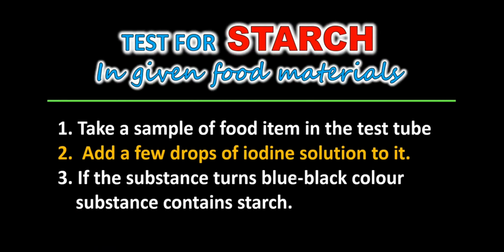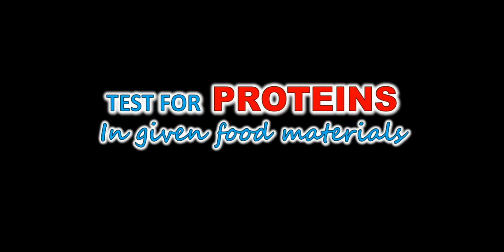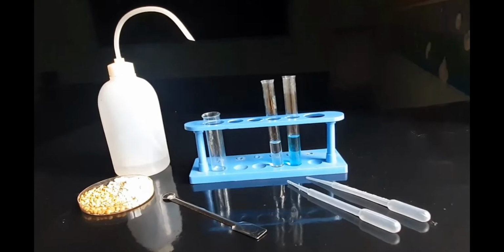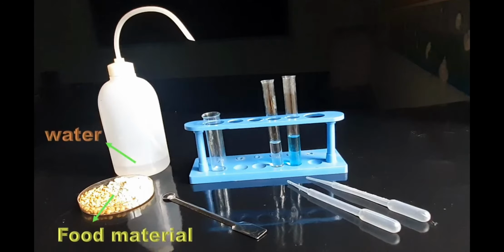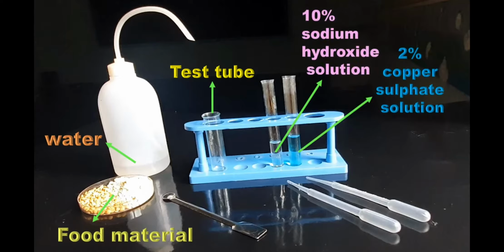So this is the test for starch in given food material. And the next is the test for protein in the given food materials. For this test we need food material, water, test tube, 10% sodium hydroxide solution and 2% copper sulfate solution, and a dropper.